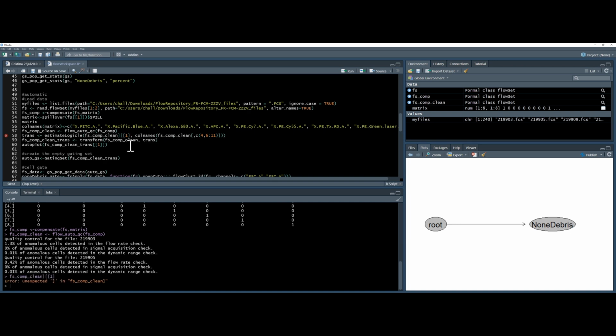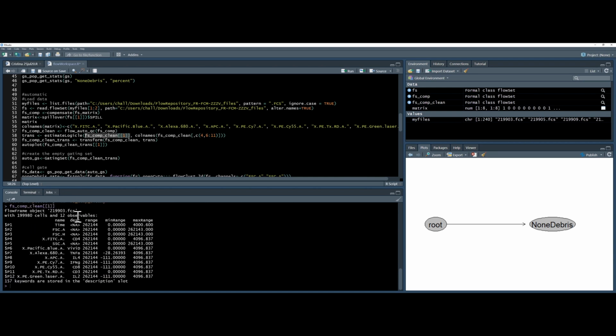Oops, I broke my brackets there using my giant cursor. Not recommended ever to use a giant cursor. Control Enter, and I can see that I want to transform parameters 4 and 6 to 12. So to do that, I use the C command again. So this allows me to group numbers together. So I'm using 4, 6 to 11. Actually, I'm lying, I need 12. It's 12. Lovely, and press Control Enter.